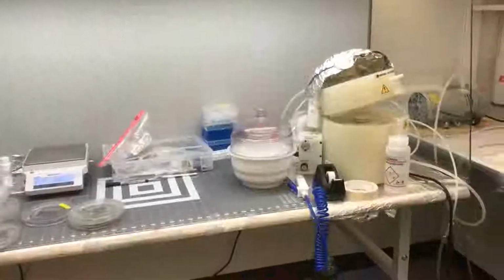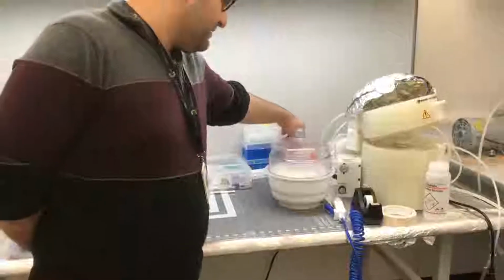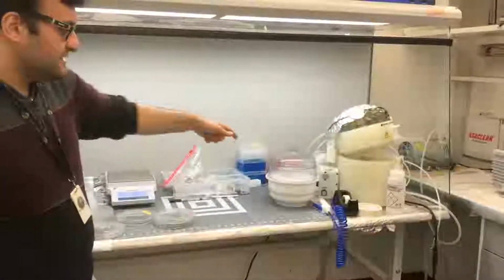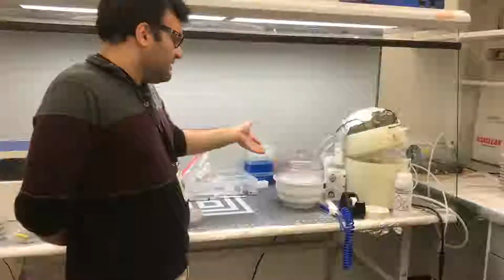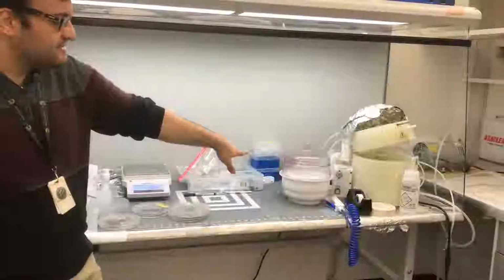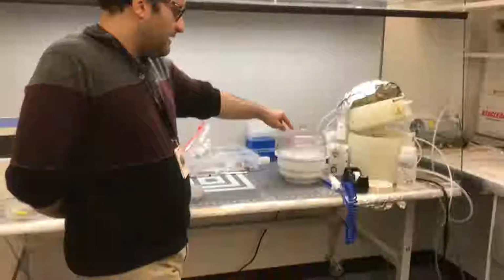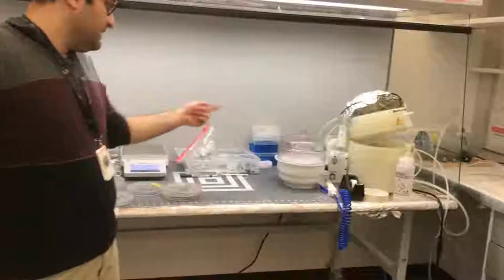Sometimes during the process you can open this knob to remove the air and then close it. But try not to do it too much. It's better not to release the air frequently because it affects the mixture of PDMS and curing agent, and it cures during the vacuum. For this reason, it's better not to add more than 40 gram in each cup of this size. Can you put more than 2 cups there? Yes, you can put 4 cups simultaneously. But you should not overfill: don't add more than 40 gram of PDMS to each cup.